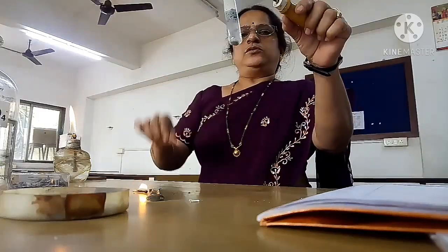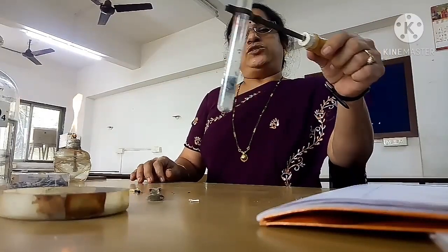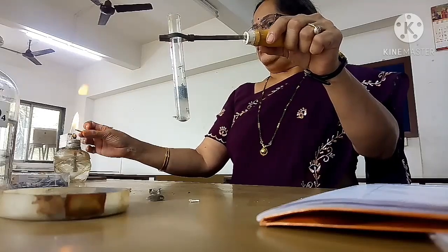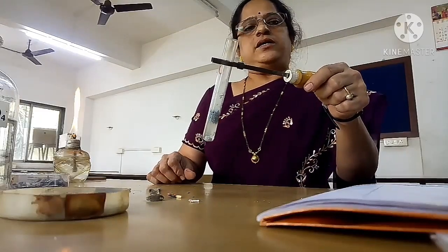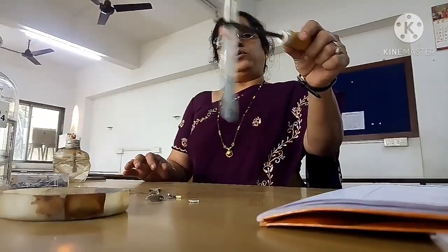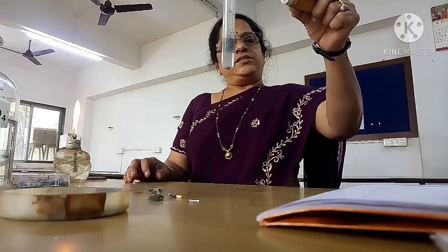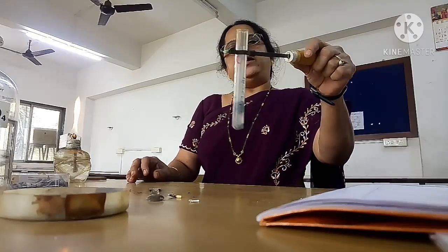It burns. So what is the reaction happening over here? Zn plus H2SO4 gives ZnSO4 plus H2. Hydrogen gas gets liberated and it is burning. It doesn't get extinguished, but it burns. Here zinc acts as a reducing agent. Zinc is more reactive than hydrogen in H2SO4, and that is why it displaces hydrogen from dilute acids, and hydrogen gas gets separated and liberated.